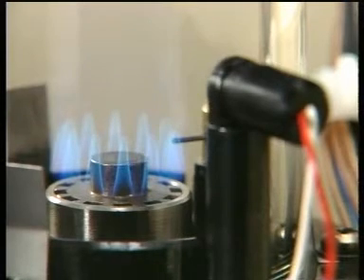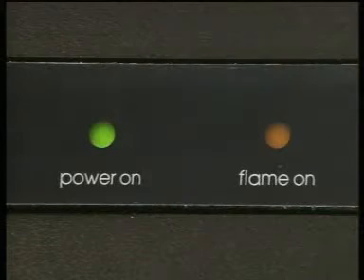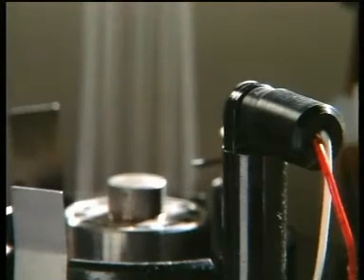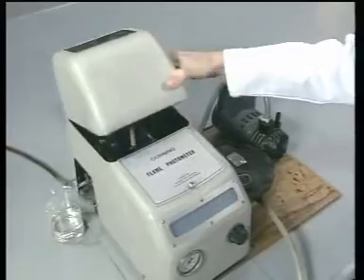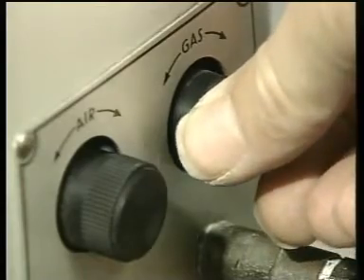The presence of a flame is sensed by a detector and indicated on the front panel. If ever the flame is extinguished during operation, a signal from the detector shuts off the gas supply. When using older instruments without these safety features, take great care to follow the operating instructions exactly, since there may be a risk of forming explosive gas-air mixtures.